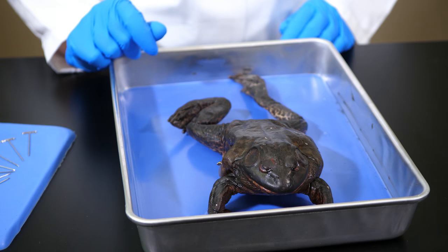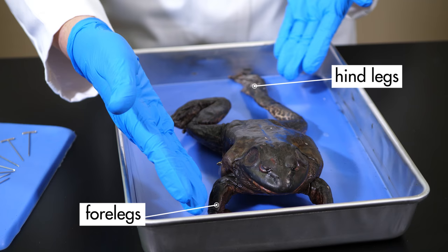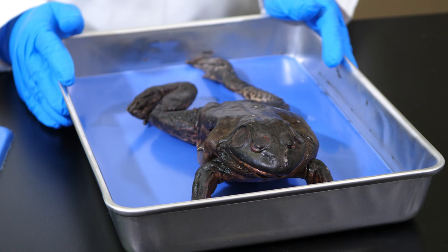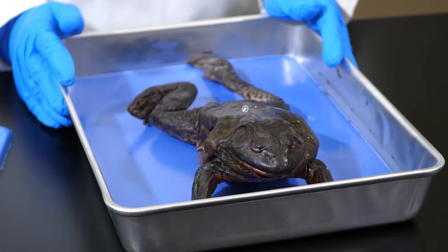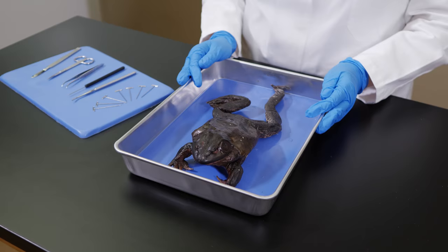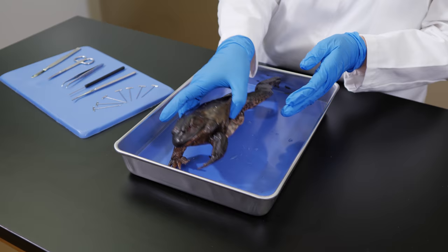If we are discussing the forelegs and the hind legs, we say the forelegs are anterior to the hind legs. Or, the forelegs are posterior to the eyes. The back, or upper portion of the specimen, is called the dorsal surface. A view of the upper portion of a specimen is called a dorsal view.